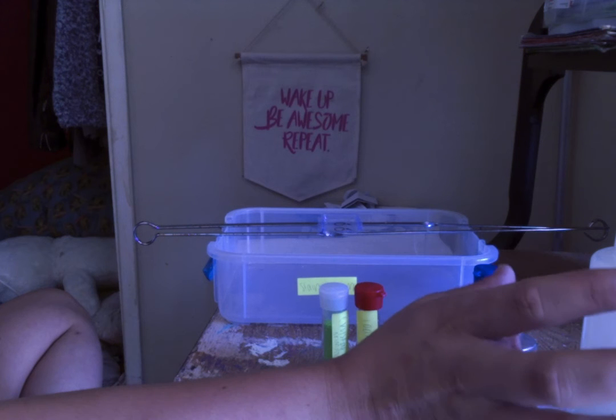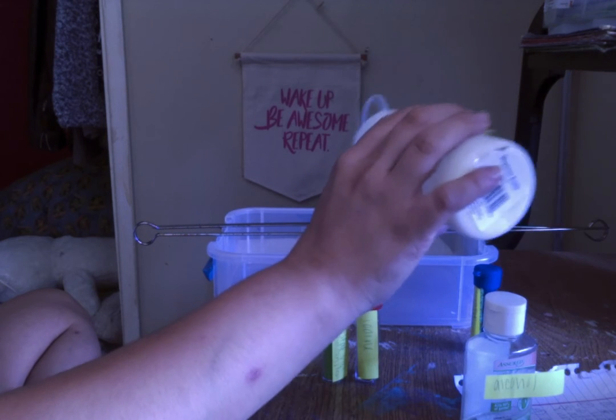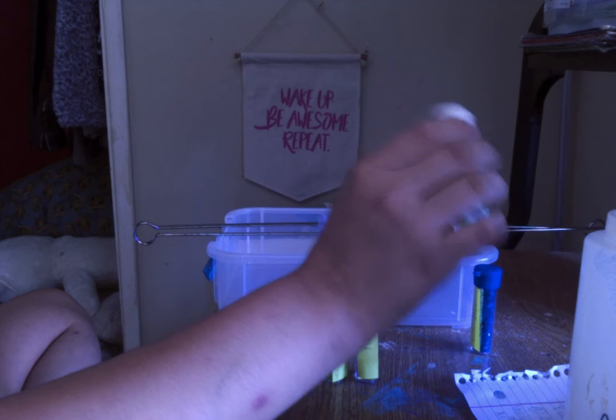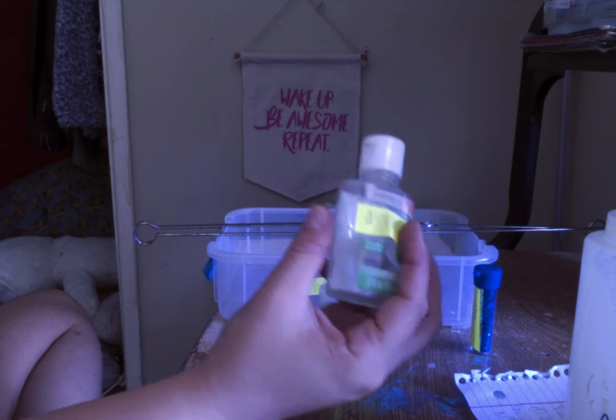After that, you're only going to let the iodine set for about 15 to 20 seconds. And then you're going to rinse it as well with the water. The next step is probably the trickiest and one of the most important that you get it right. The decolorizer or the alcohol.